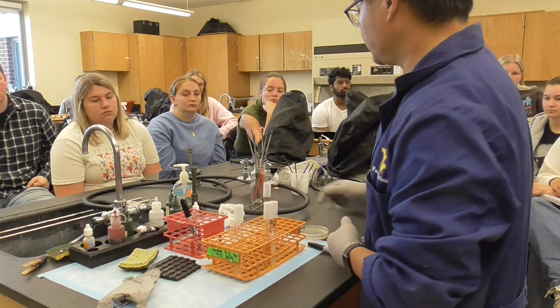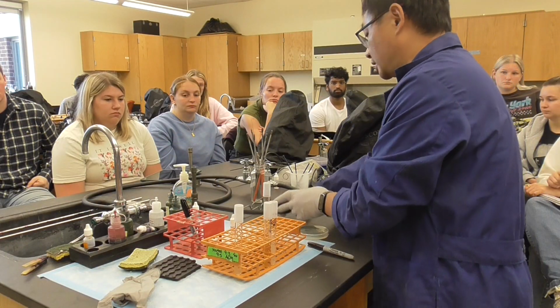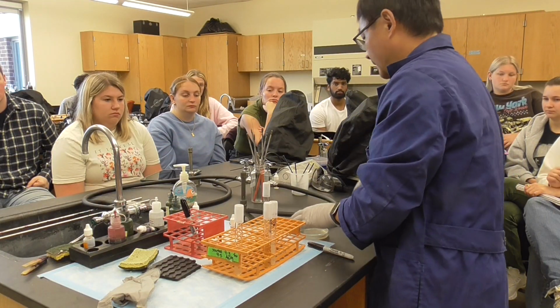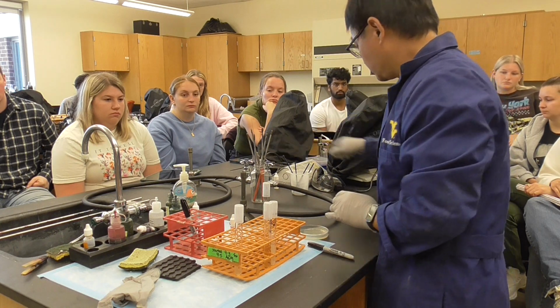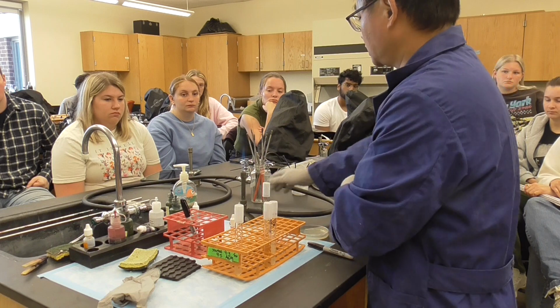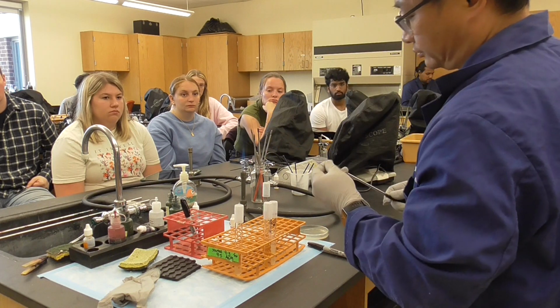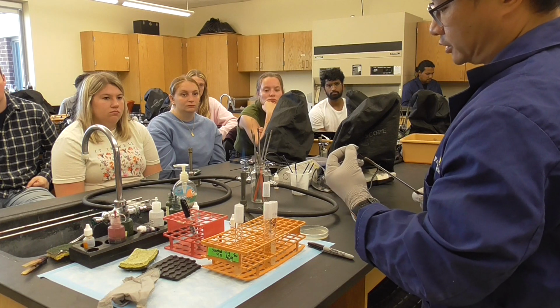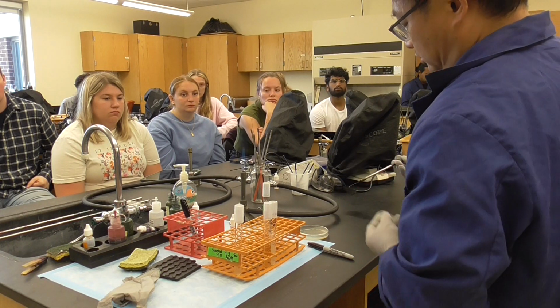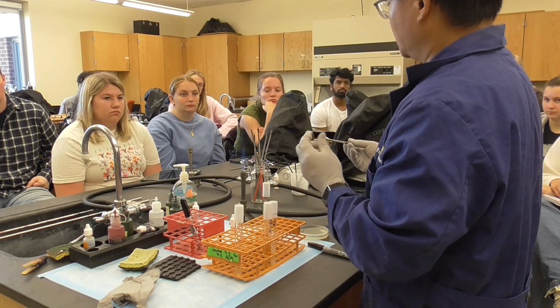Okay, so these are the things we have to do, the label, before we transfer the bacteria. Obviously, we need the Bunsen burner. So make sure the Bunsen burner works. So we're going to try to turn on the Bunsen burner. Okay, that looks good. And then make sure your loop is good. This is very important for the streak, and really have a loop on the top, okay?